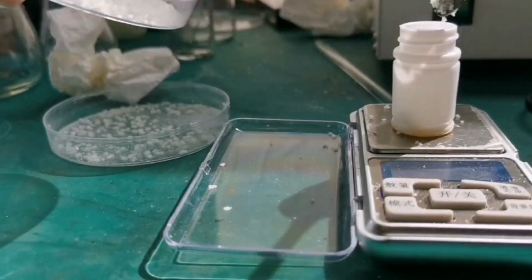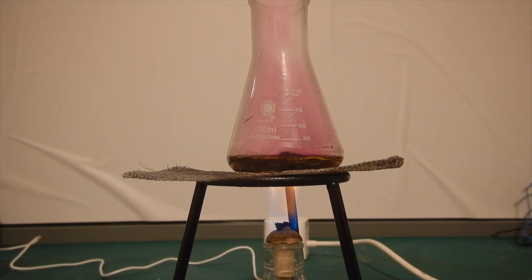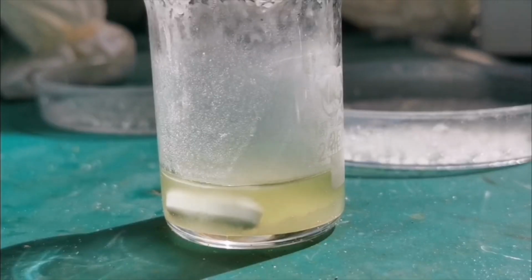In the end, my yield of potassium iodate is 6.33 grams, which represents a percentage yield of 49.3%. It was actually not a super bad yield, since I lost some of the initial iodine as vapors, and a huge amount of the remaining iodate is in the crystallization liquor.